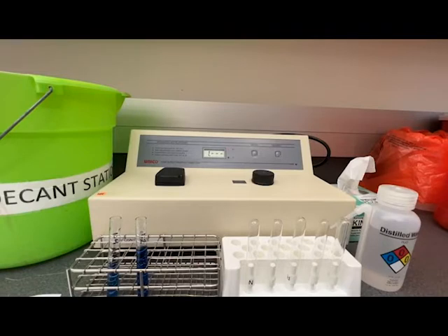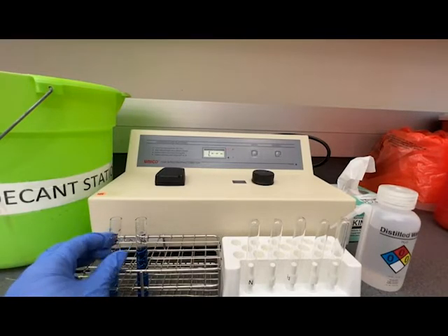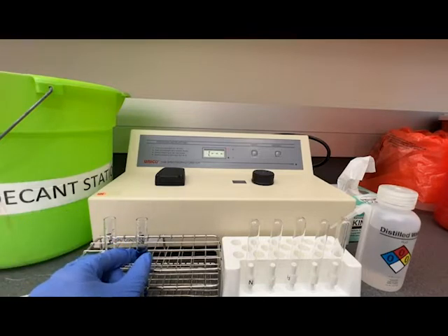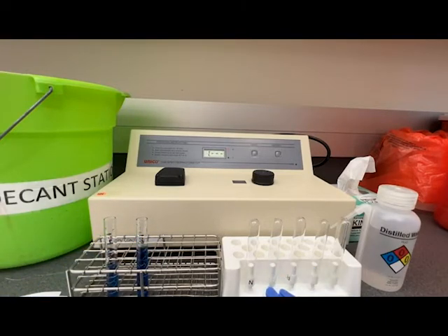In this video I'm going to demonstrate how to use a spectrophotometer. I have a 1 to 4 dilution and a 1 to 2 dilution, and these are special cuvettes made of glass that does not have a lot of interferences in the spectrophotometer.